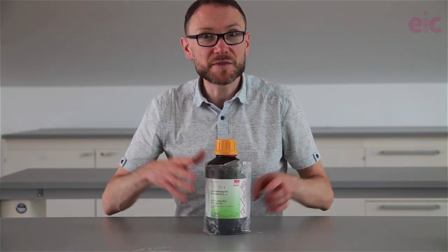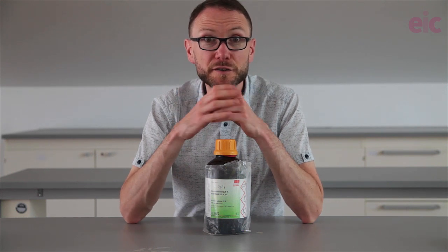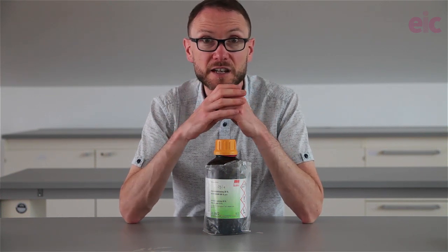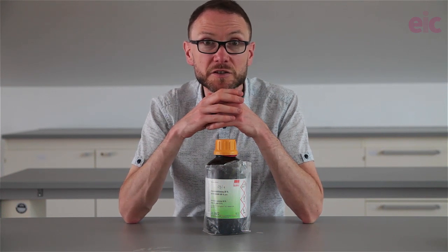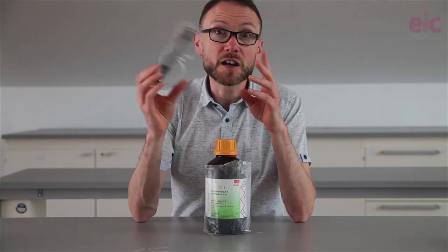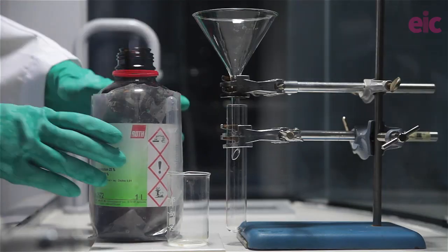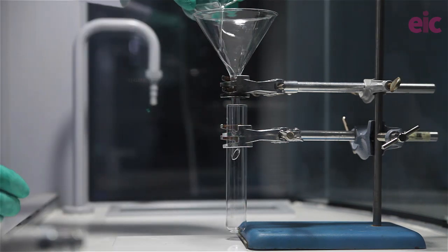About 10 cm³ of ammonia in a boiling tube will be more than enough for a flask, and I was able to fill a few for this video just from one boiling tube. Although if you are filling larger items like gas jars, CLEAPSS definitely recommends using a fresh boiling tube of concentrated ammonia each time. Because we're using concentrated ammonia, that's why I'll be working in a fume cupboard and wearing splash-proof goggles and gloves.